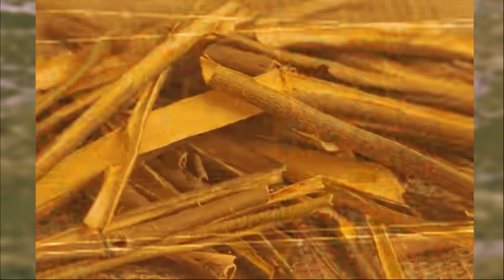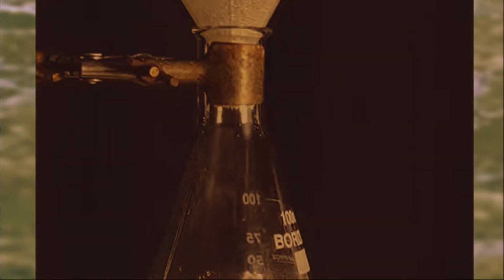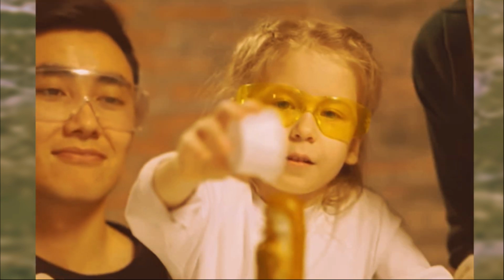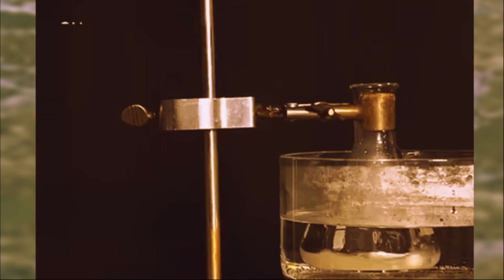And if you're wondering how it's made, today's video will take you through the process of its making on a large scale. Step 1. Gathering the main ingredients. You might recognize the word salicylic acid from beauty products these days, but this ingredient has a much longer history.